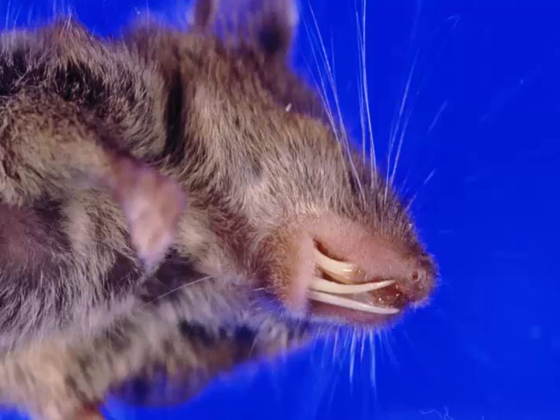Malocclusion. As opposed to rabbits, mice and rats generally have no predisposing causes. There's no change in length of either the mandible or the maxilla to account for something like this.